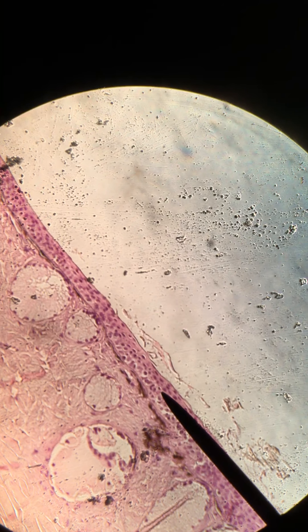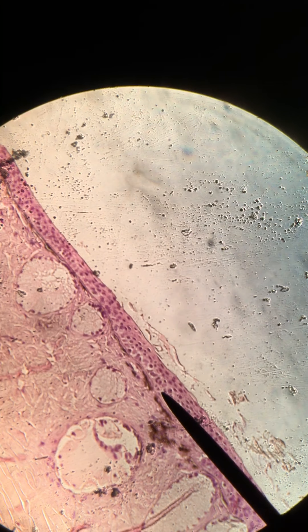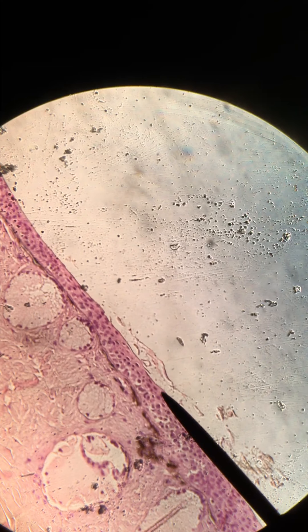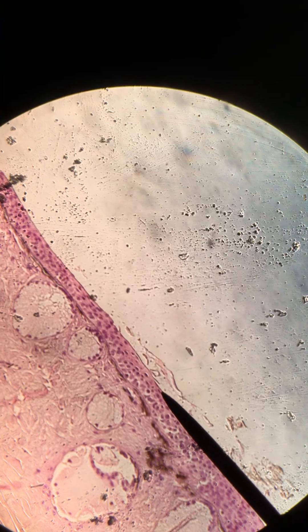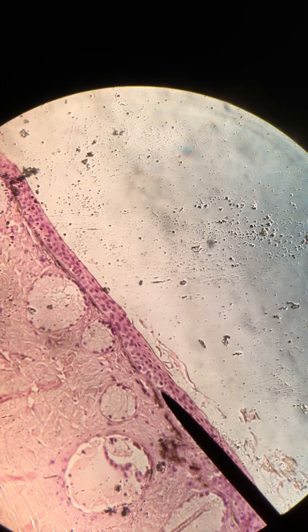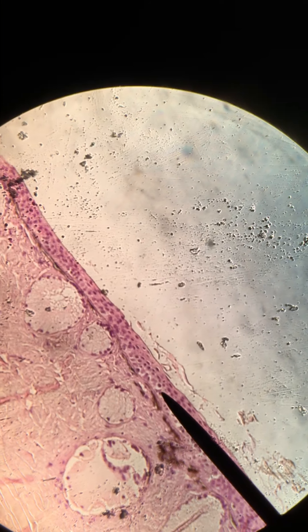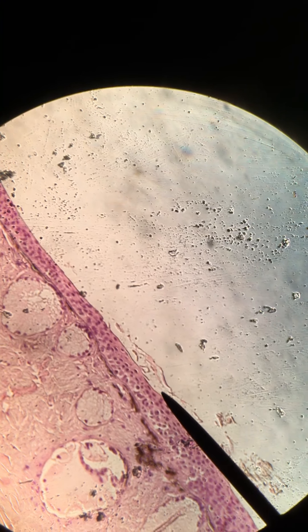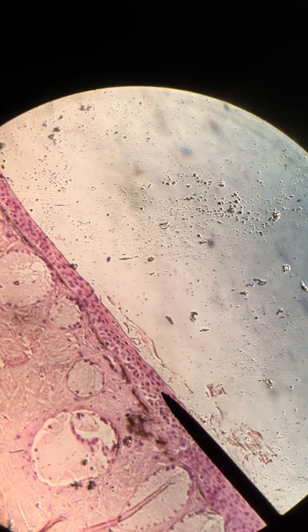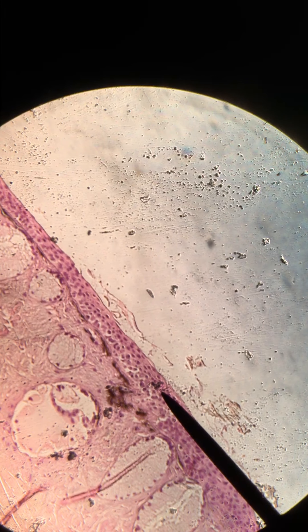This is our stratified squamous epithelium, and you can see that based on the fact that there's more than one layer of cells, all of this is epithelium with the topmost layer appearing to have squamous cells.